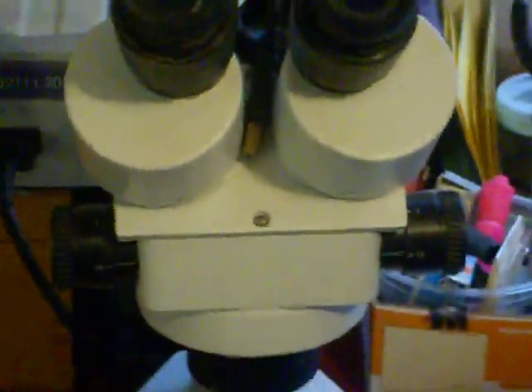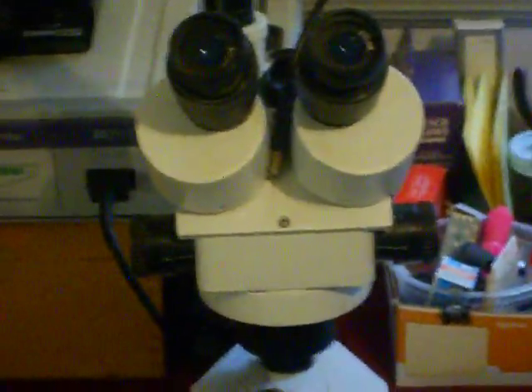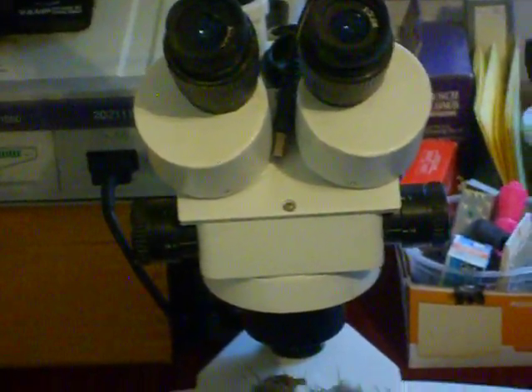So the first microscope is a dissecting microscope. The use on that is really so that you can select the proper sample to put onto a microscope slide, of course cover with water, and cover with a microscope slip.